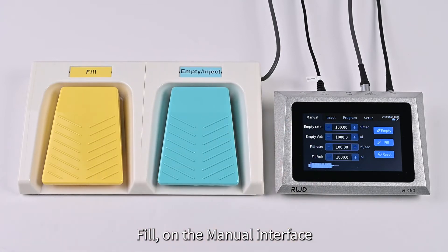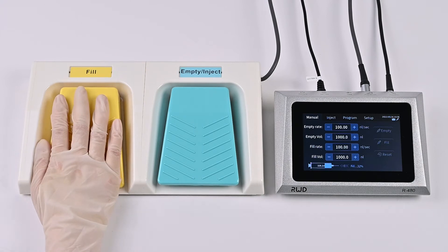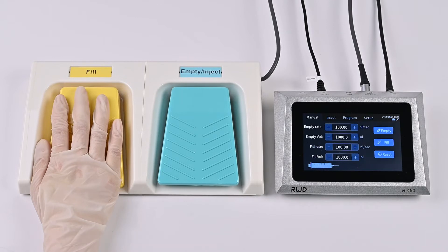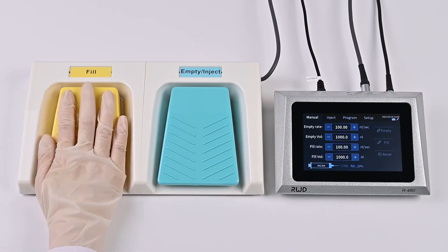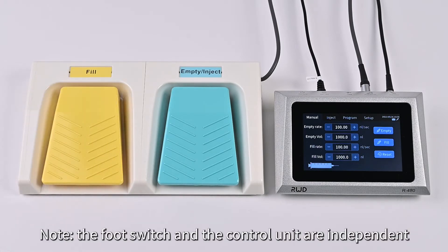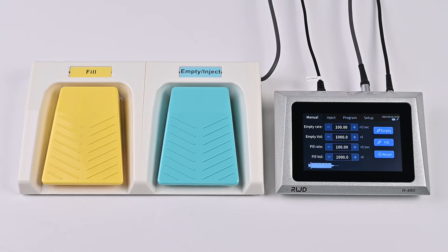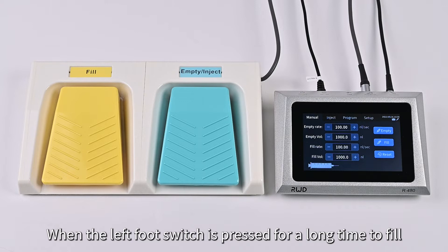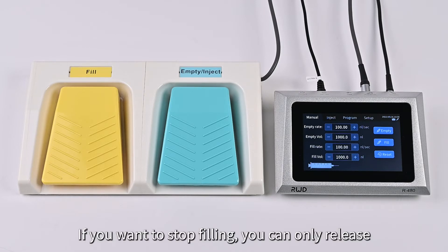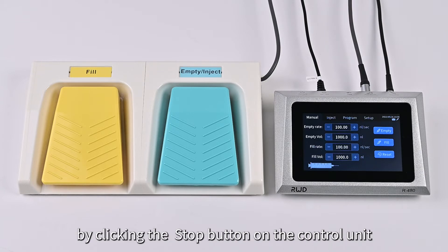For Fill: on the manual interface, press and hold the left footswitch to fill. A beep will be heard when the filling is completed. Release the left footswitch to stop filling. Note: the footswitch and the control unit are independent of each other during a process. When the left footswitch is held to fill, you can only stop filling by releasing it — it is not possible to stop filling by clicking the button on the control unit.